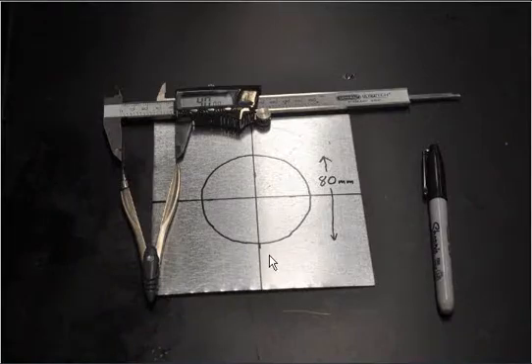And then we're going to draw an 80 millimeter diameter circle around the center. So I left 10 millimeters on the radius to let the steel grip the lens. If you actually need to use the whole 100 millimeter diameter of the lens, then you need to adjust this or buy one of the fancy mounts or whatever you need to do. So this is going to give you an 80 millimeter window.